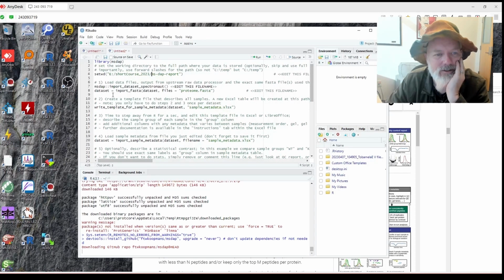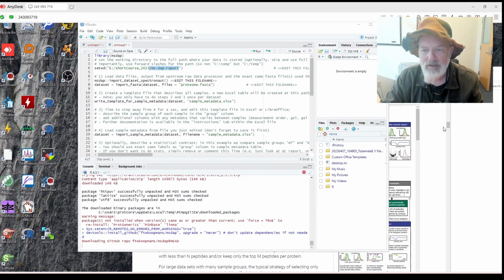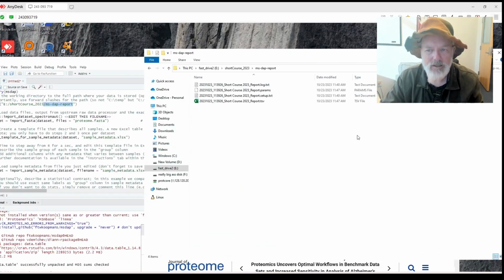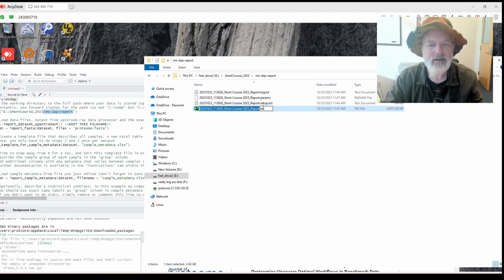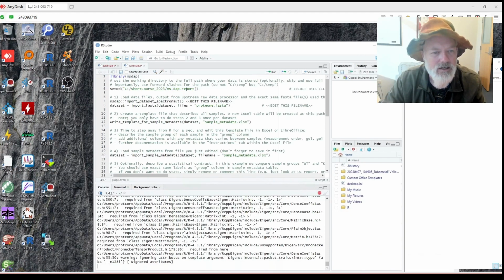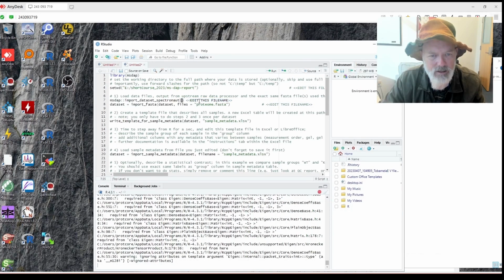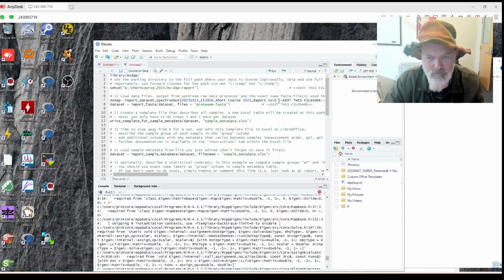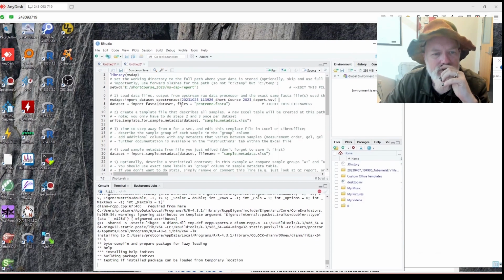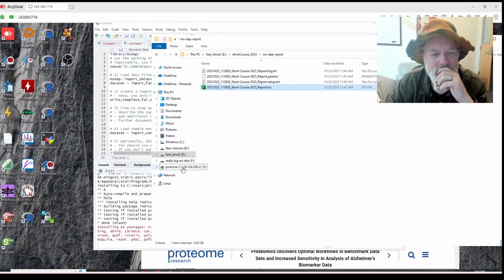So we set the working directory. Let's see, edit this file name, which would be what I like to do. Okay, I like to right click and hit rename. And that way I don't spell it wrong. Sometimes it can have issues with... let's see if I did that right. It will also need the FASTAs. So I also put, let's see if I put the FASTAs in here, and I didn't. Let's see if I have.